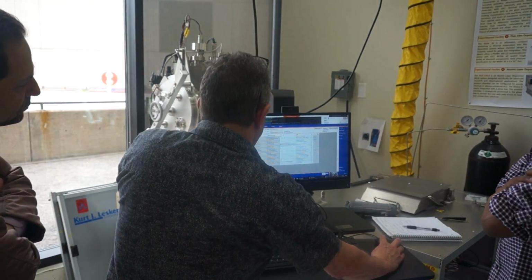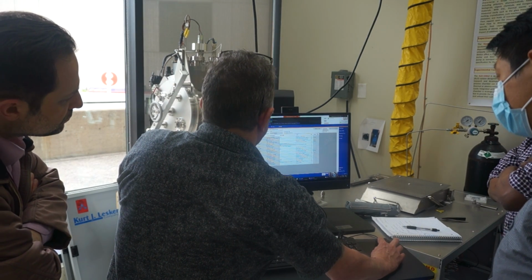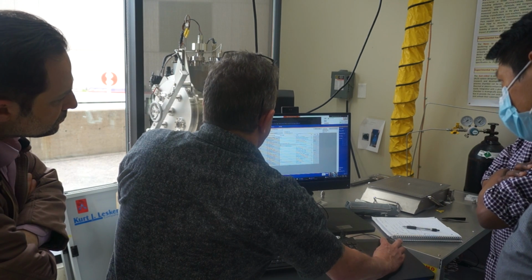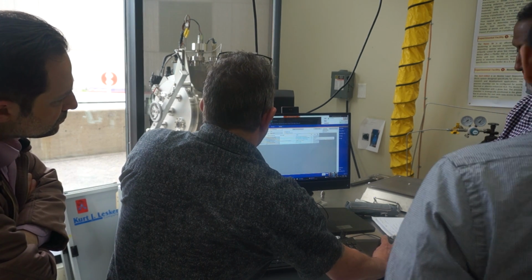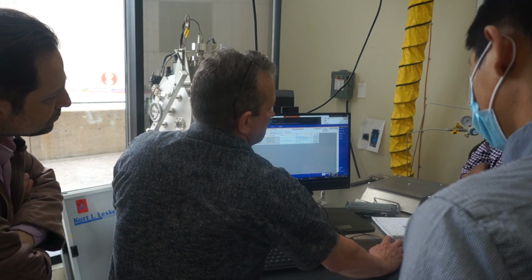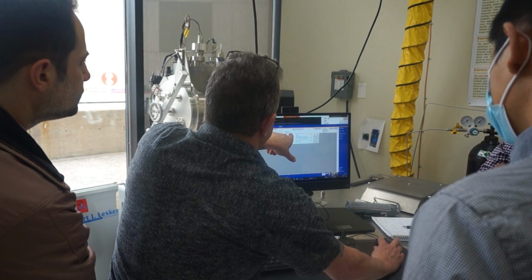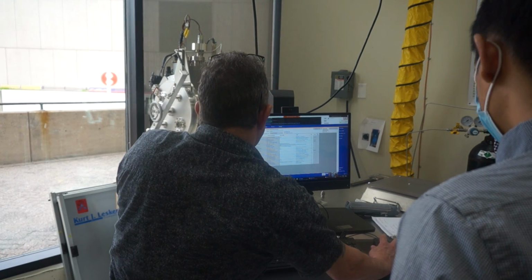That's just the computer speed for the line. Then it automatically runs the sub-recipe. In the sub-recipe, it just does a check to make sure we're not running another recipe. Since I was in a sub-recipe, I can come back to the master recipe.